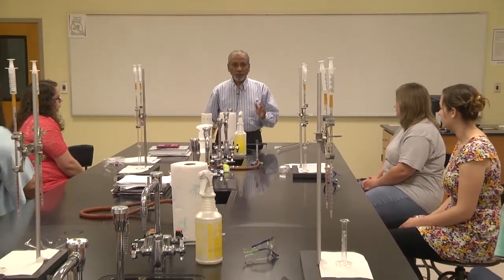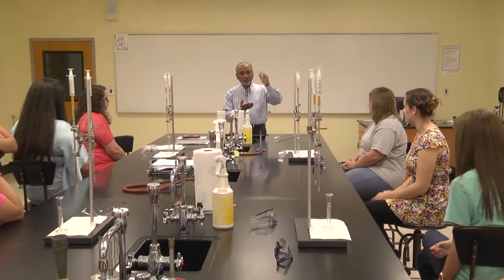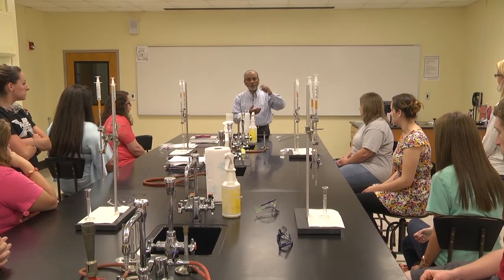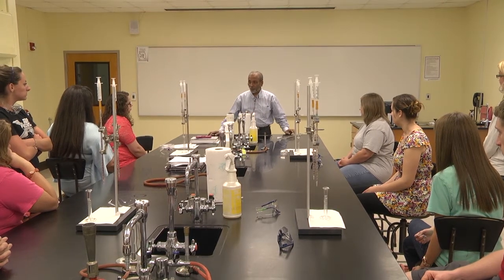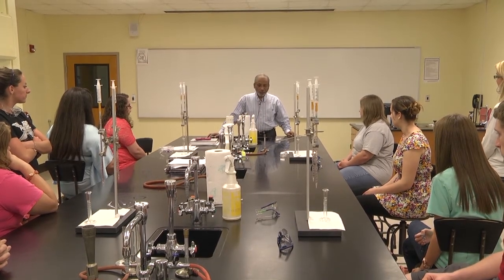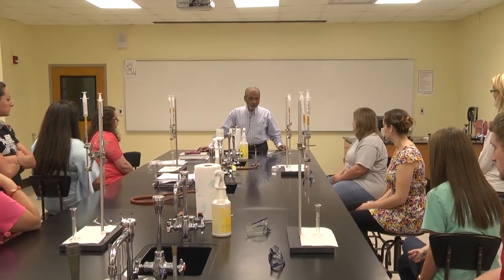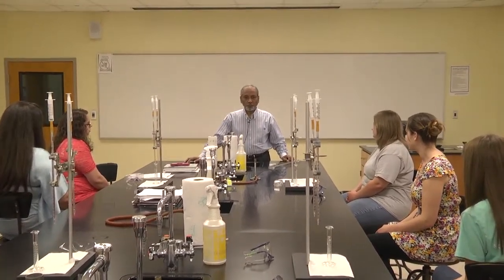In the class you have learned acid-base reaction, right? What happens when acid reacts with the base? It forms salt and water, right? So in this reaction, you are titrating vinegar with sodium hydroxide. So sodium hydroxide is going to react with acetic acid, and it will form a salt. So what is the salt going to be? Sodium acetate. Very good. Sodium acetate, and water also will be formed.